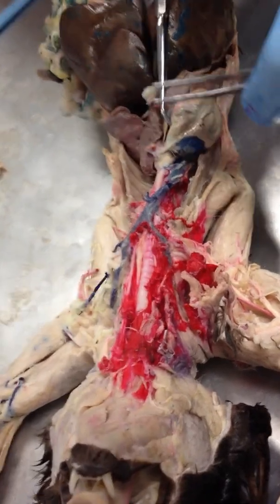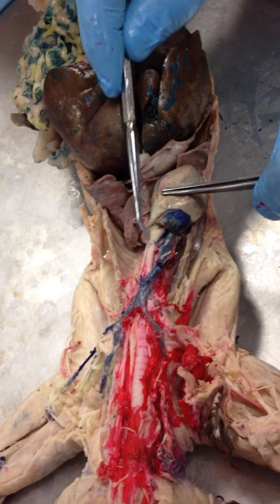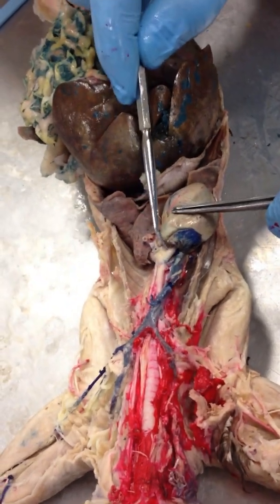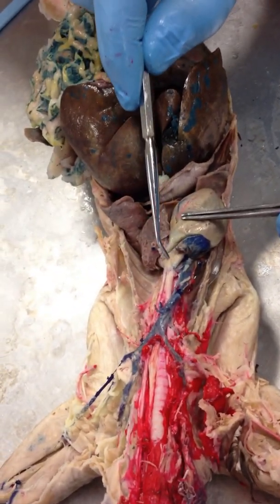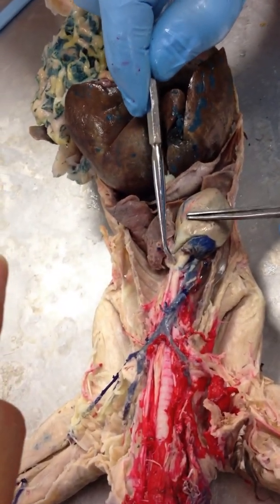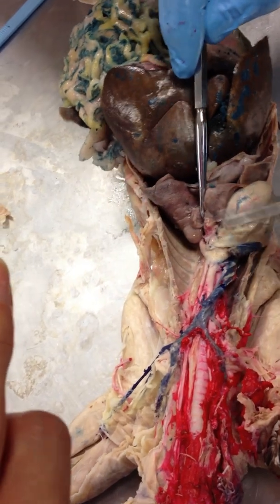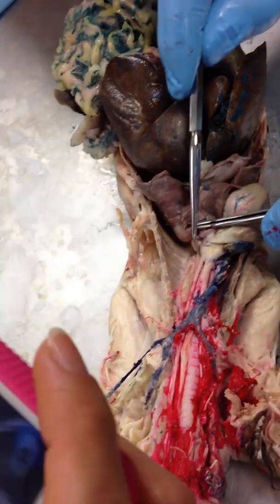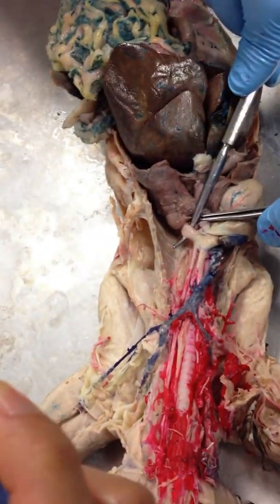This is the heart. This is the aortic arch right here. The first part is the ascending aorta. This is our aortic arch, and then this is our descending thoracic aorta right here.